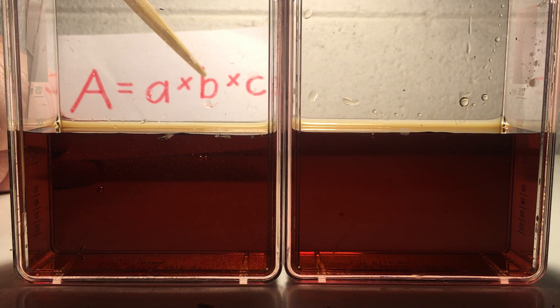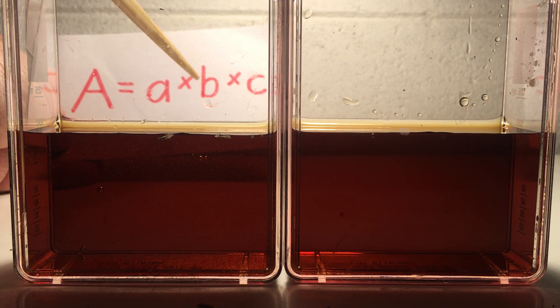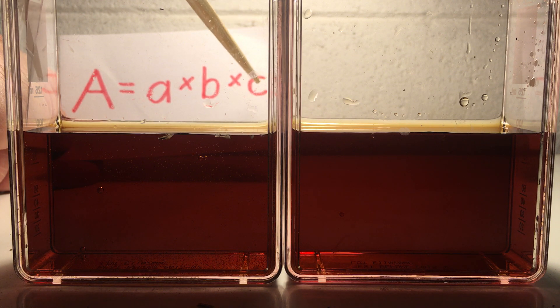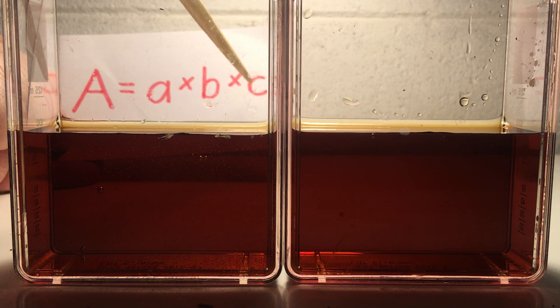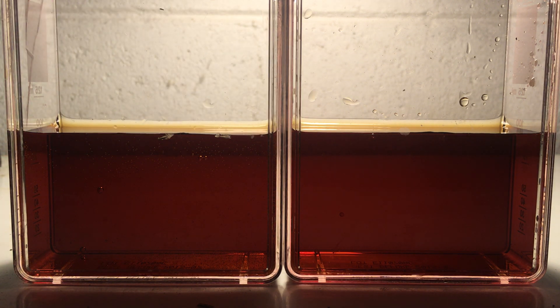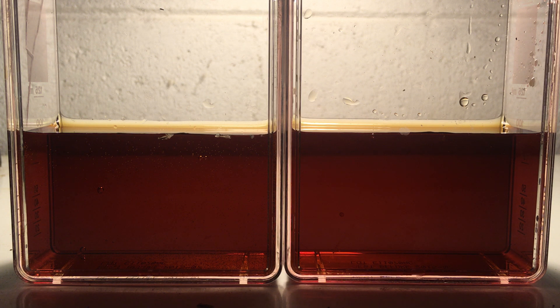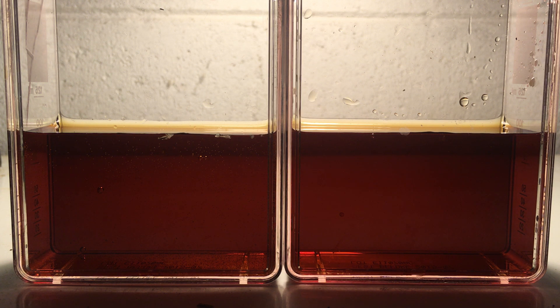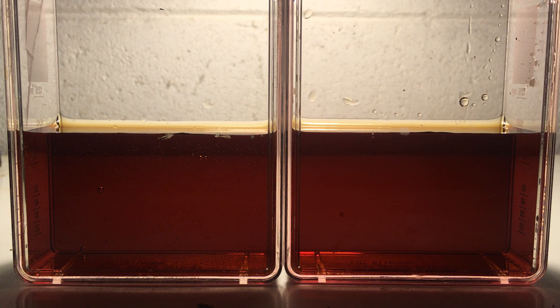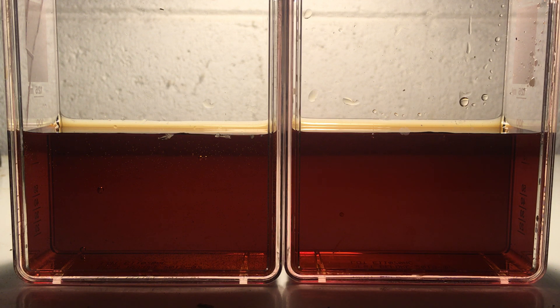I thought what better way to talk about absorbance of species in solution and Beer's Law than by using root beer. So we have some root beer solutions in these sort of rectangular containers.